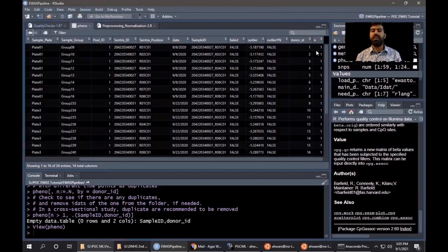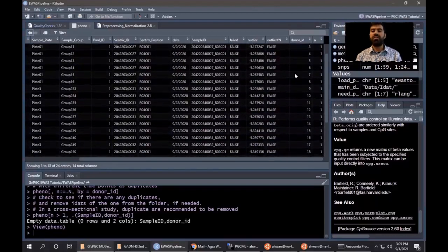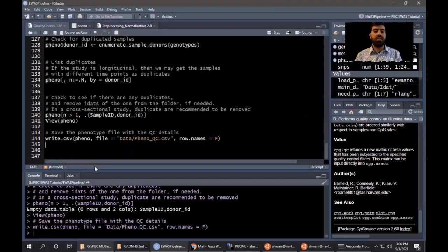And we have the donor ID and the number of samples with the donor ID. So in case of a longitudinal study, where we have more than one time point of data for a participant ID, it will have the same ID for that participant. So as we have unique samples, all these IDs are unique. In cross-sectional analysis, we need to remove the duplicate samples or IDs. Then finally, we will write this data so that we can use it in the next quality control steps and downstream analysis.